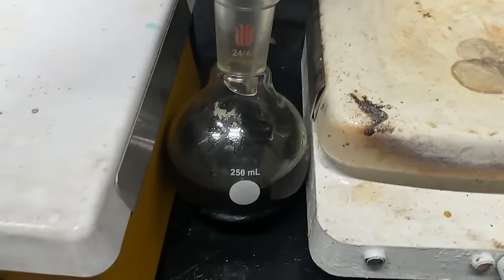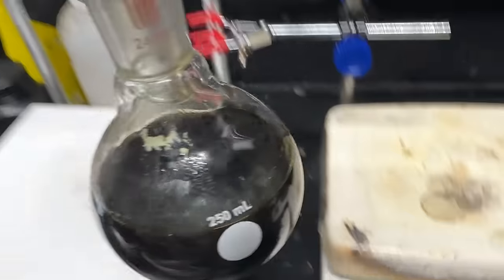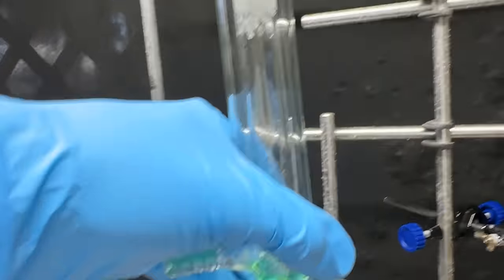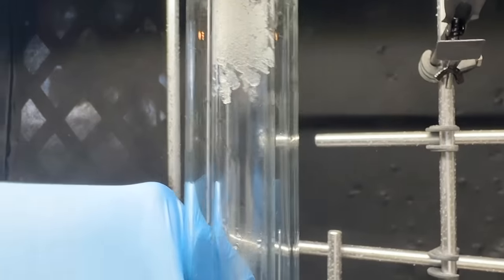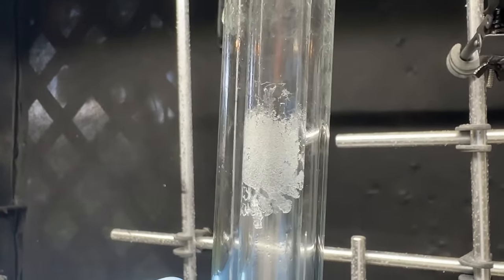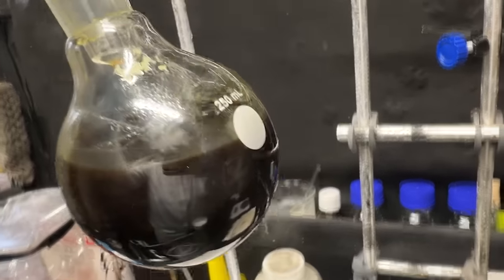Here's our finished reaction mixture — it's been going for approximately 36 hours. Some of the water came out, and there's this compound on top that has crystallized right above the reflux point. I have no clue what that is — maybe free-base histamine that went up. I don't know, but let's start processing this.